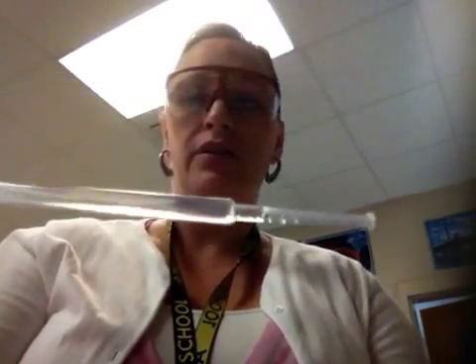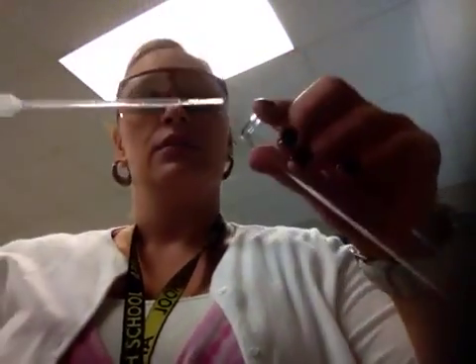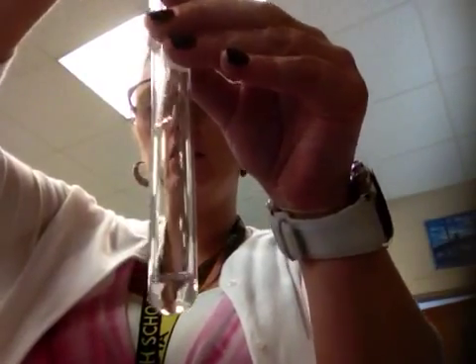Welcome back. Our adventures in chemistry continue. Next we're going to do a reaction with zinc acetate. Zinc acetate looks like this — it's a clear liquid you can see in the pipette. I'm going to put my zinc acetate here in the test tube.